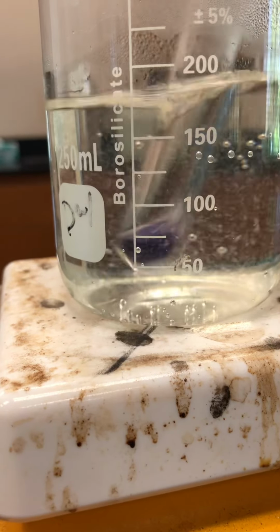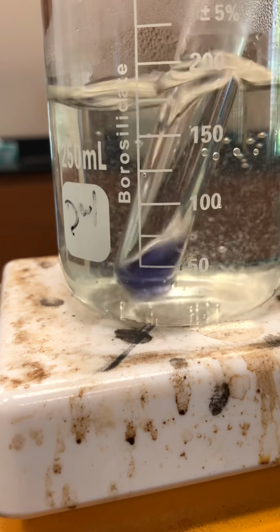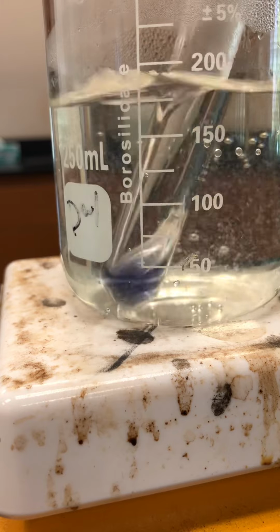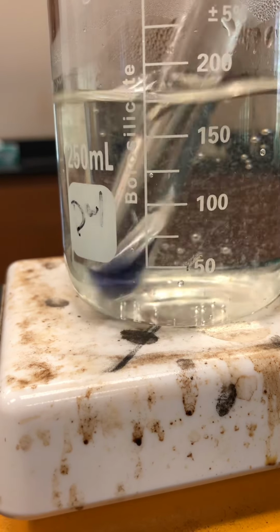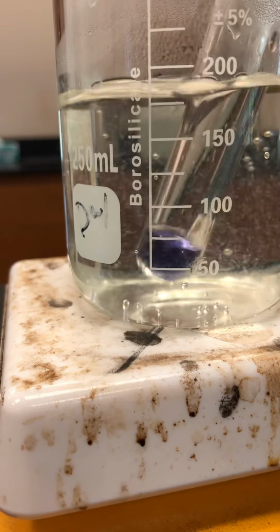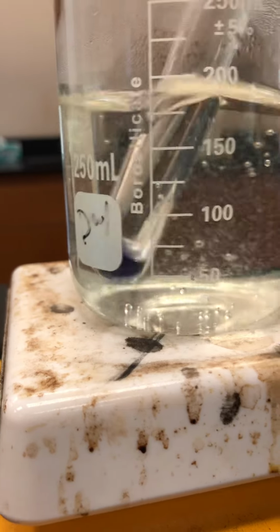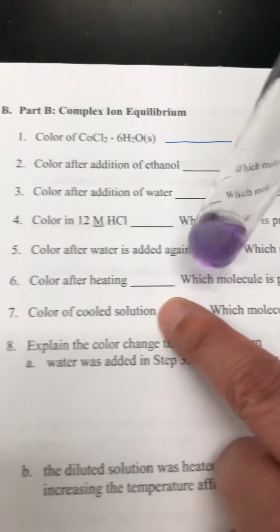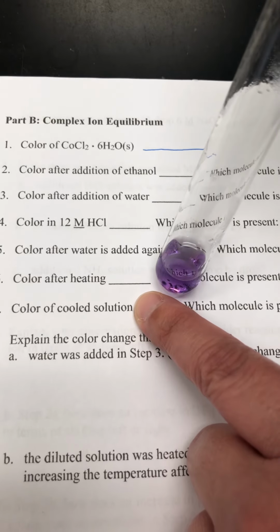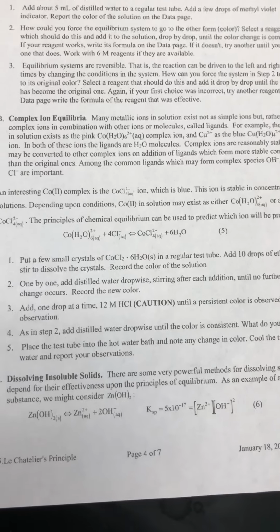Okay, definitely we're seeing some changes from whatever color it was before. Do we think that's significant enough? It didn't go all the way back, but I think we could tell that at least it wasn't the color it was before. So now, so that doesn't drip, what's our color after heating? And if it's somewhere in between, it's probably the next step over.